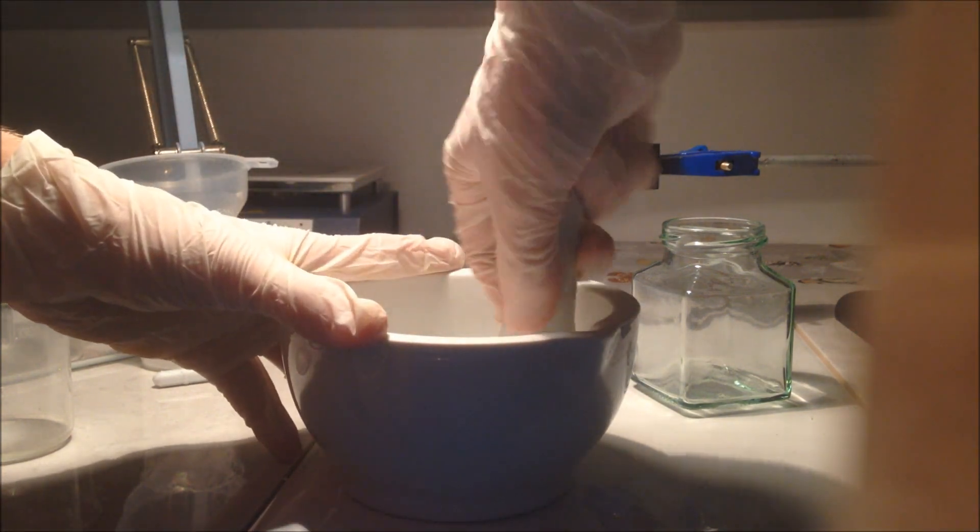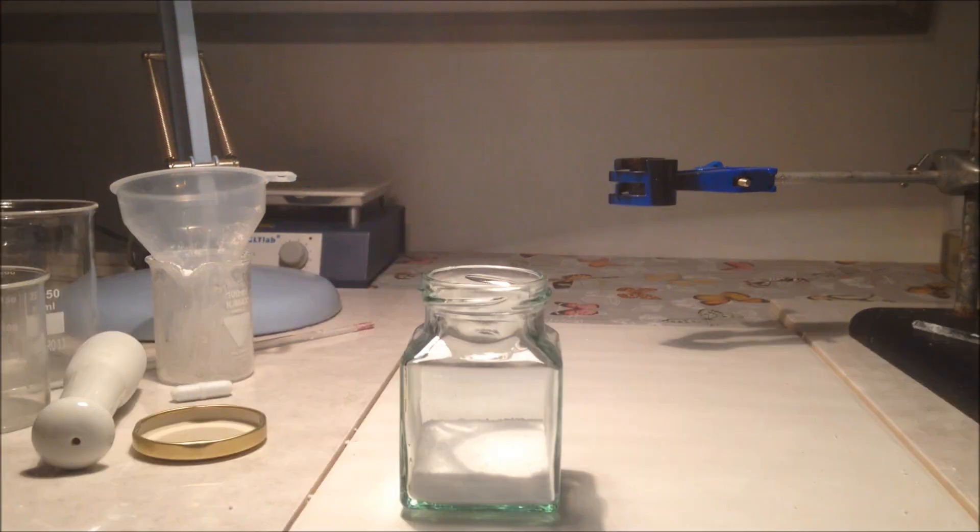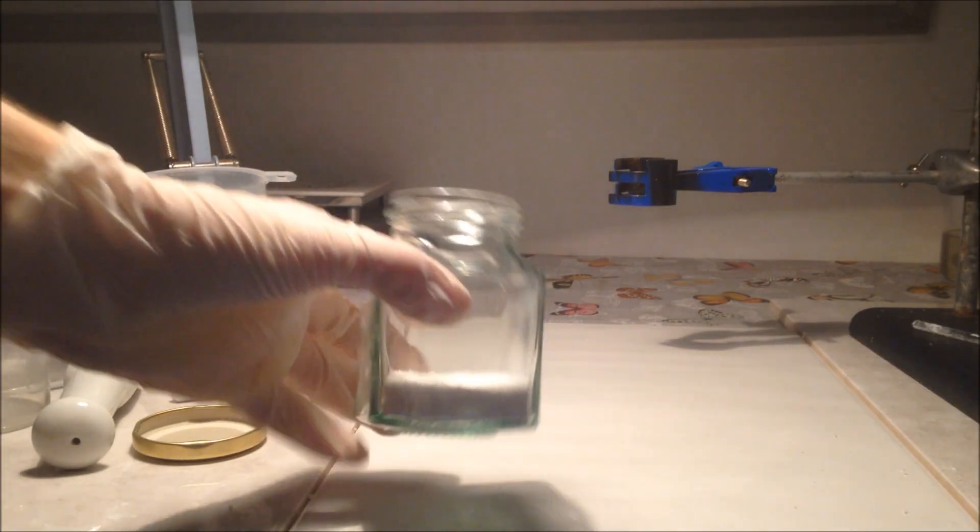I got out my trusty mortar and pestle just to crush it up a bit, to make it a bit more easy to work with, a bit more free flowing.